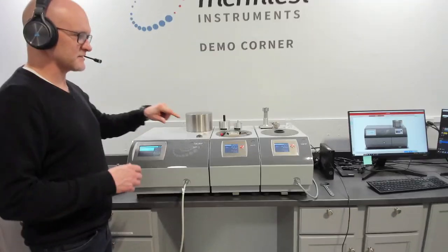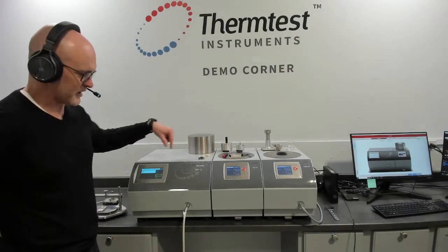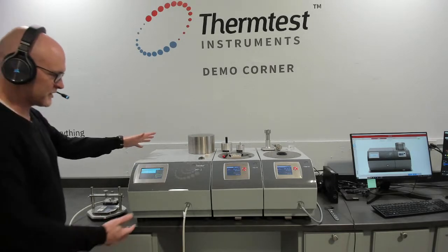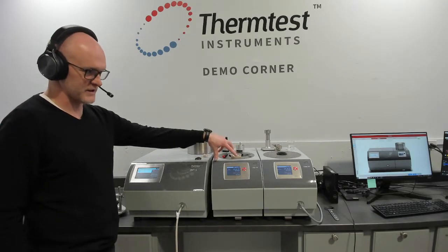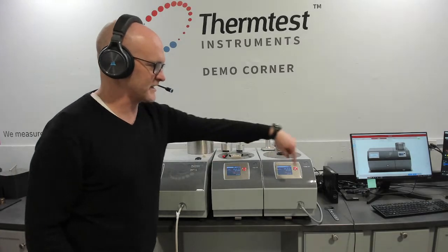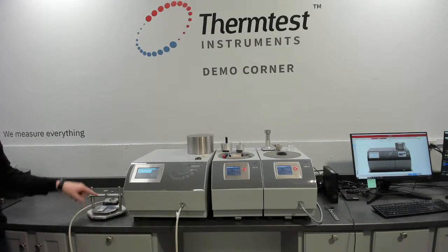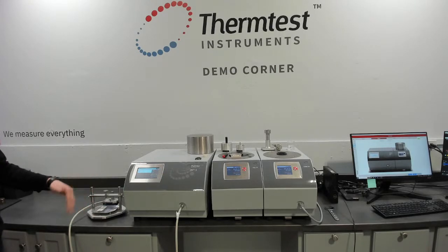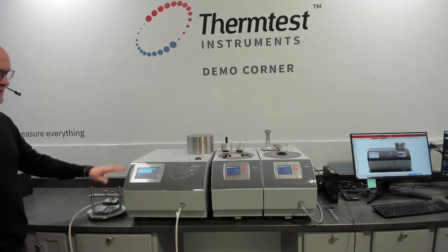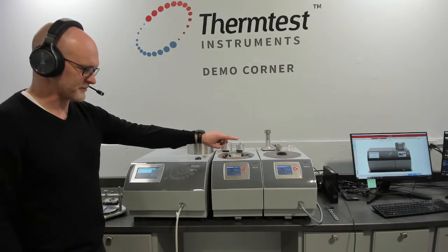So coming back to the MP-1, we wanted to spend a little bit of time showing the measurement platforms. Again, those work in concert with the MP-1, the temperature platforms do, because of the expandability. So every MP-1 controller can be purchased with a temperature platform for the transient plane source method or the transient hot wire method, or any combination thereof. There's 4 channels on every MP-1 controller, so you can make a measurement at room temperature on the bench with both methods. This is just the sample holder for transient plane source. We have a transient hot wire equivalent, room temperature bench measurement. And you can connect, if you need it, the ability to measure temperatures with the temperature platforms.